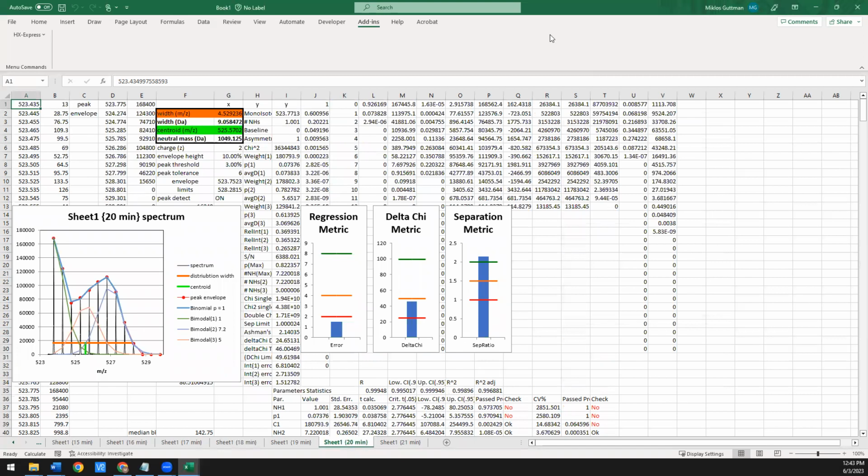Okay, so it did a triple. Here's that third population now. And yeah, it looks great. I'd be surprised if it didn't look great. With a triple fit, you have so many parameters you can adjust. It'd be kind of hard to imagine a scenario where you don't fit great. But you see from this p-value from the f-test, the p-value is 1. And this has to do with the fact that you don't have enough number of points in the data to give you the degrees of freedom you need and all the parameters associated with the fit. So in this case, you can't statistically justify that you have 3, although there's by eye good evidence you do.